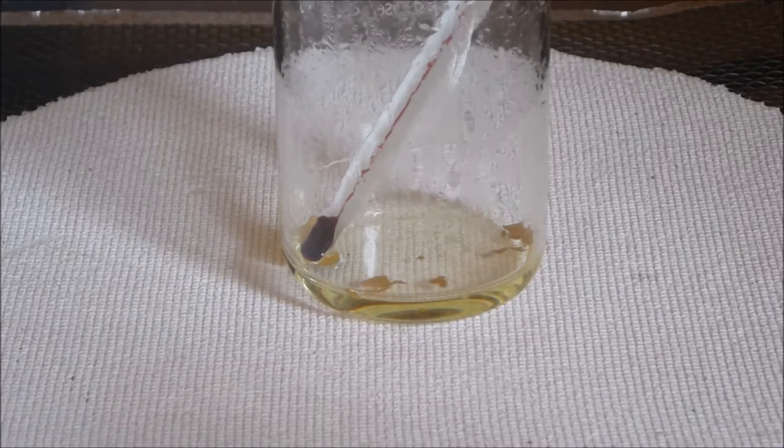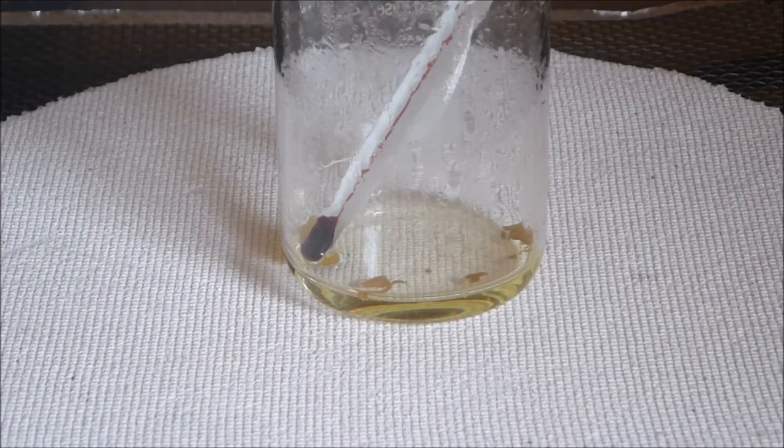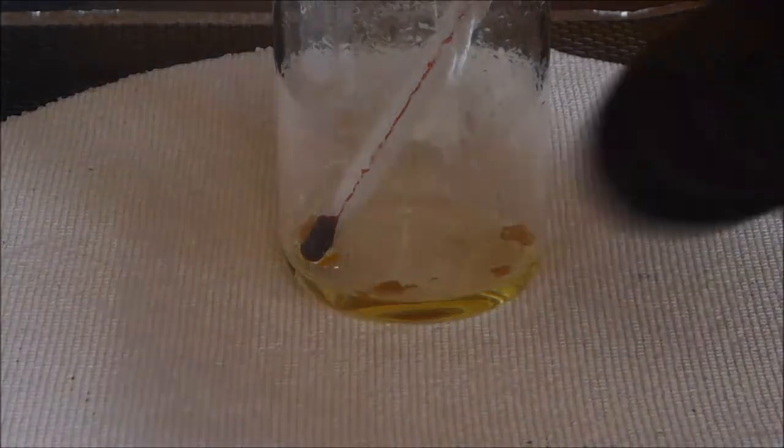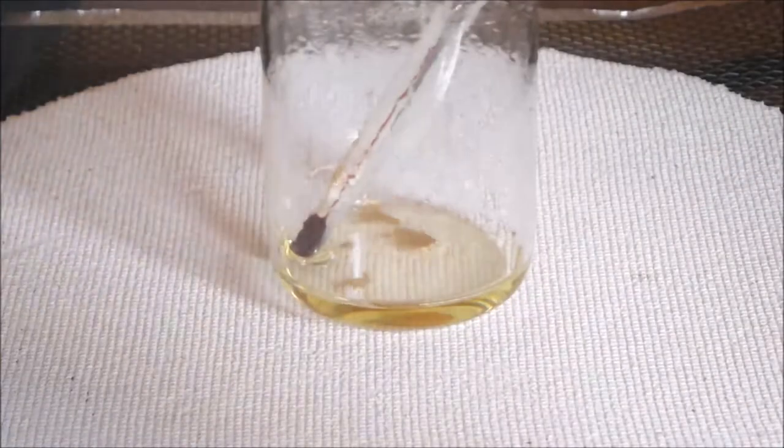Looks like we have a little bit of a reaction happening there with the gold leaf. So all signs thus far makes it look like gold.